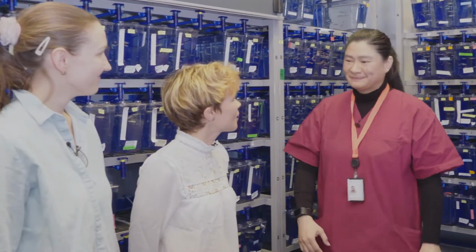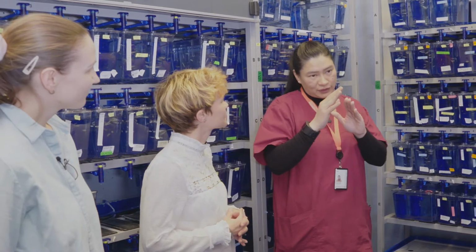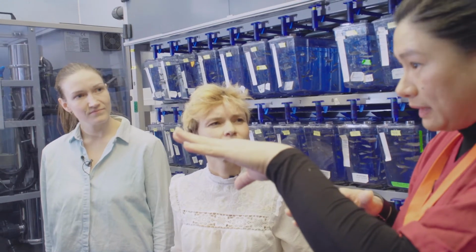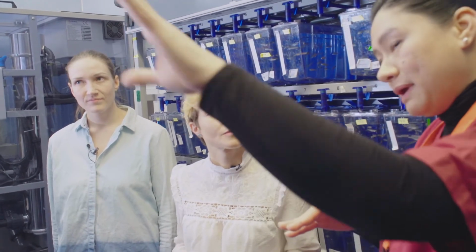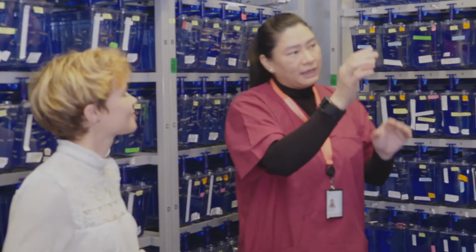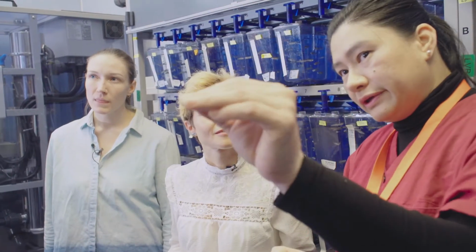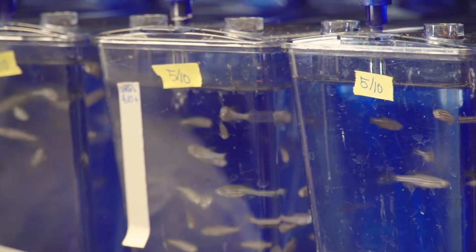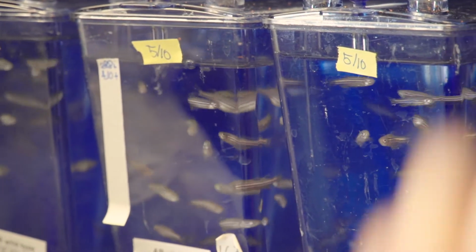And so I see there's different ages, do you start working on them as juveniles? Yes, they are starting first in the larva bench. We are keeping them until 21 days, jumping after to the baby rack where we are controlling the stream, because they are not developed enough to swim against the current. And after, from those small tanks, they are starting to reach maturity, so they are being separated into females and males in different tanks. So they are getting sexually mature to start producing embryos.